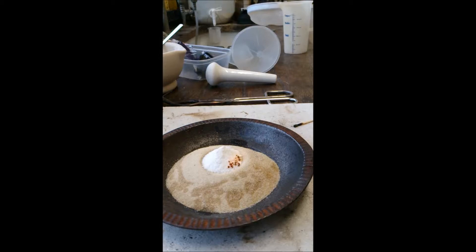You can see straight away it's starting to burn. Now there'll be some little bubbles forming, as you can see there. The ethanol burns with a very clear and hot flame. The orange you'll see in there is the carbon from the sugar burning off. And hopefully you should start seeing quite a few of what are known as the glowing black snakes forming.